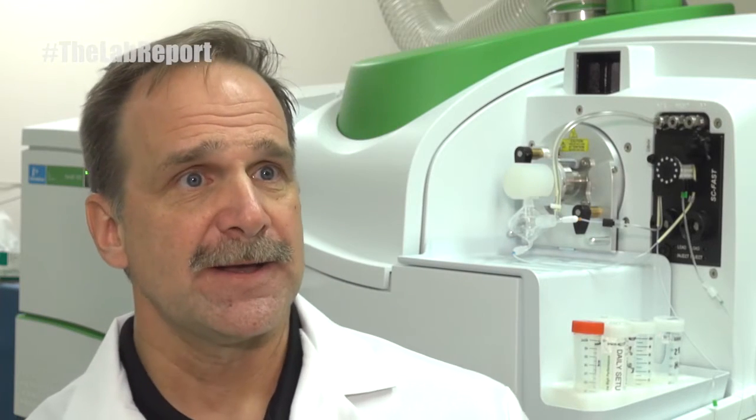One of the first issues you have to be concerned about for running wastes, sediments, and sludges is a variety of low and high concentrations within the same samples. You may be running PPT levels for some and high PPM levels for others, so many times you have to use several dilutions for the same sample. Environmental laboratories don't like to rerun samples because it costs time and money, so the Nexion has the ability to do both PPT levels and very high PPM levels in the same run. We're able to do this because our system uses a quadrupole which can be tuned for very low levels or detuned and desensitized for very high levels.